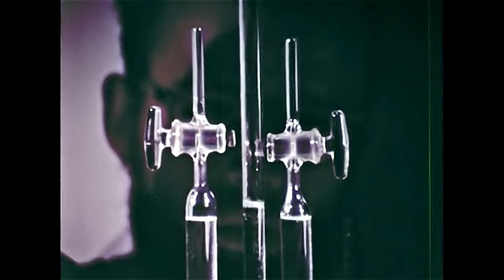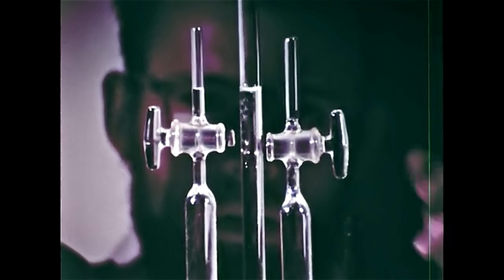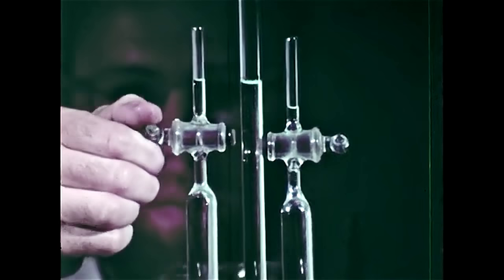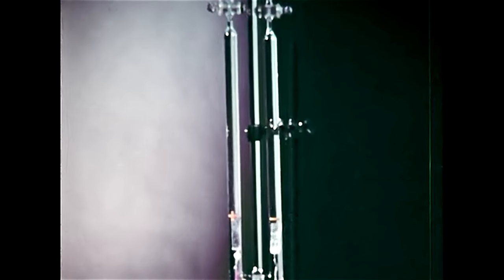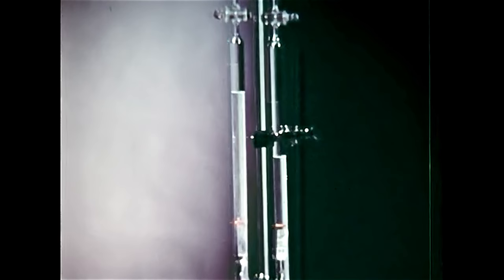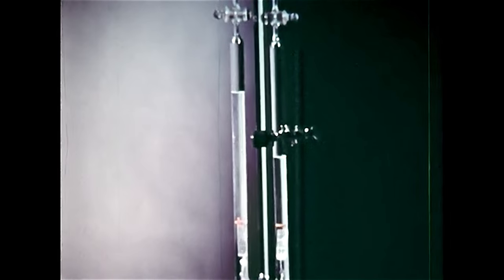The stopcocks are closed to keep the gas from escaping, and we have only to wait until enough collects for testing. Electrolysis of water is a common industrial method where power is available at little cost, and other materials can also be sold. For example, electrolysis of salt brine can yield oxygen, hydrogen, chlorine, and sodium hydroxide all at once.